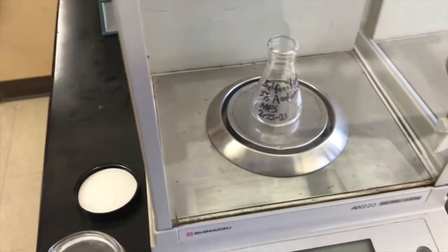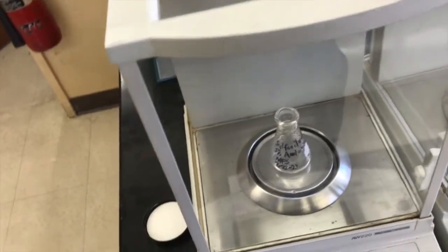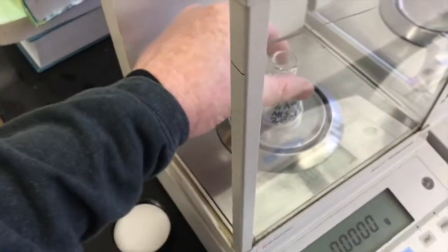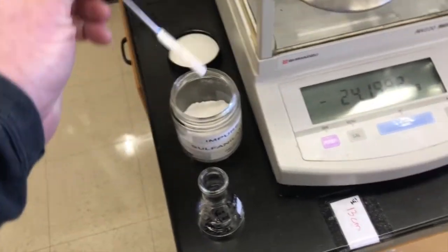No, it'll probably spill. What about if I open up the top of the scale and I go from the top, just like three-pointer, bam. No, I don't want to do that. I'm going to make a mess in my scale. What I'll do is I'll always pull the flask out of the scale and add the solid to it that way. Let me set this, yeah, I remember how to do it.